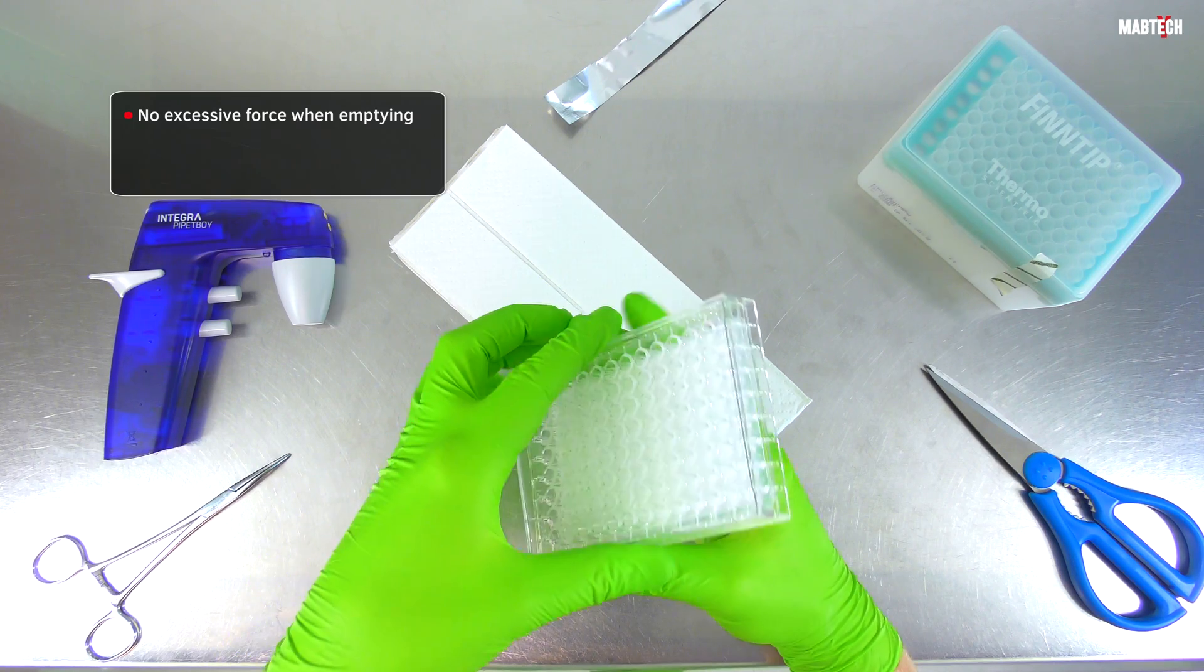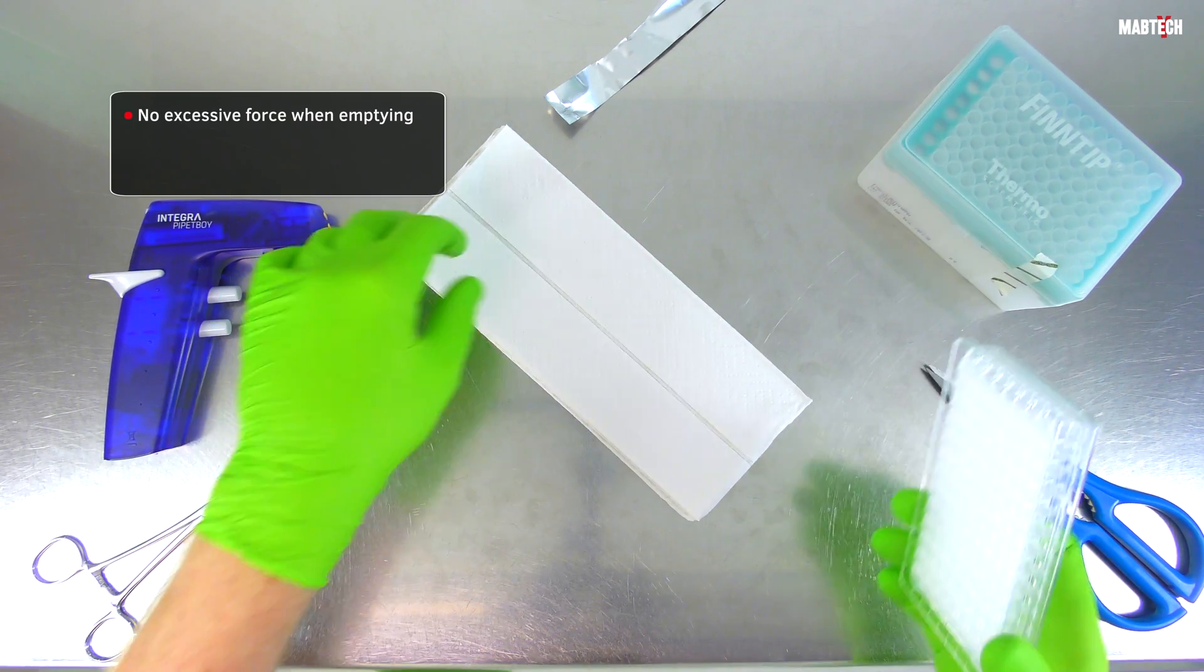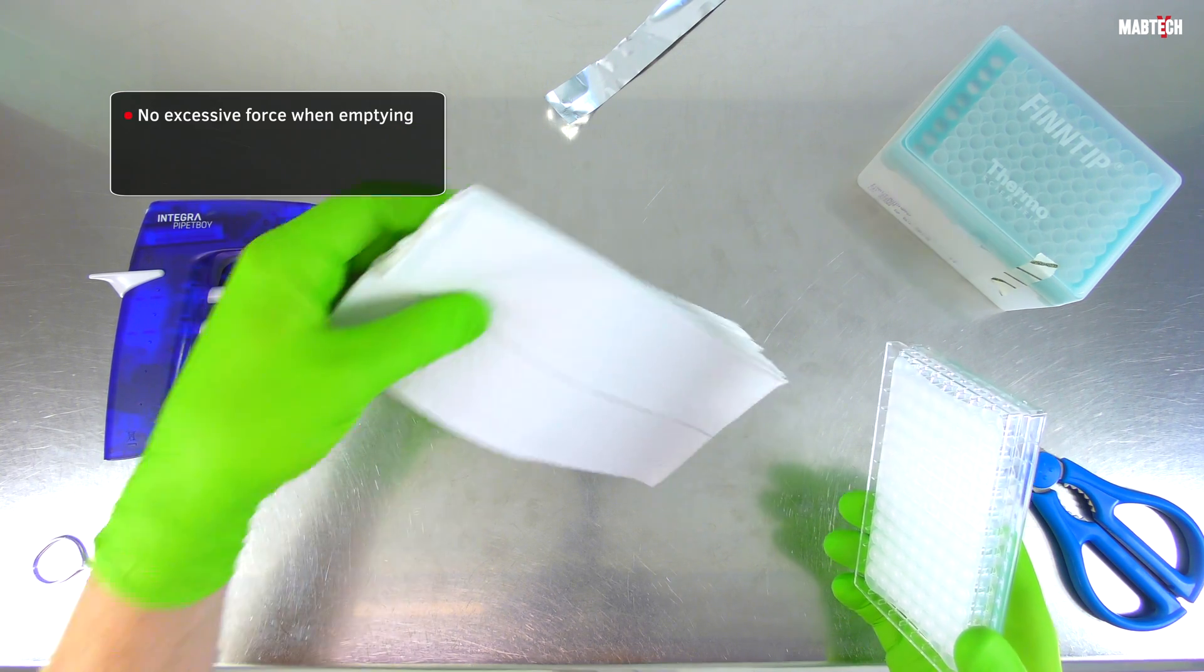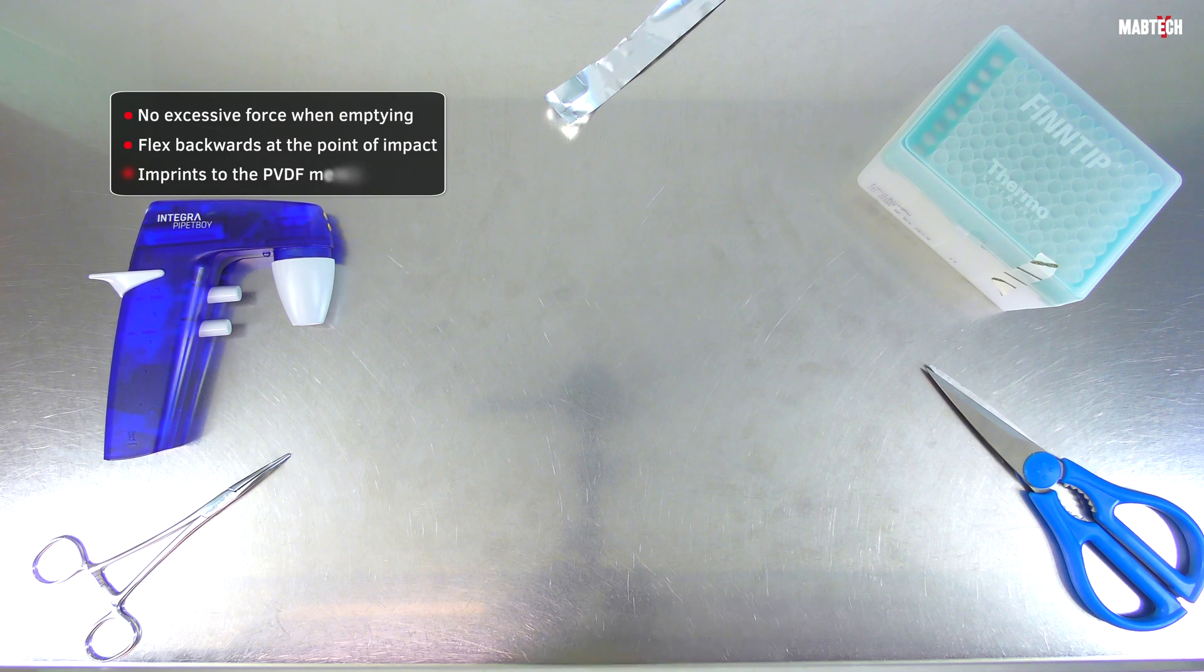In this video, little power is used, so obviously no problems here. But pushing it too hard can actually make the membrane flex backwards at the point of impact and again cause imprints to the PVDF membrane.